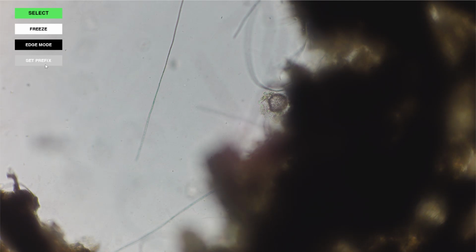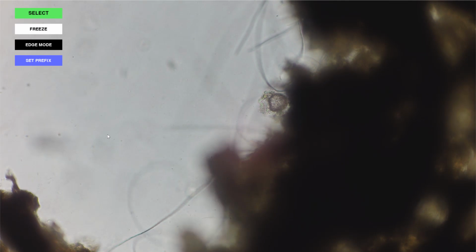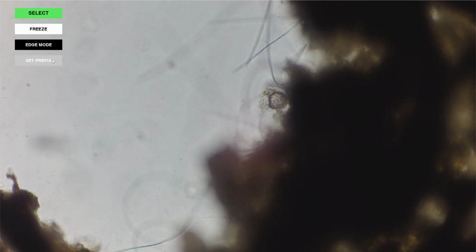element here. Set prefix will allow me to type the name of a particular tag or label for my machine learning dataset. As you may already feel familiar with, the datasets for training machine learning algorithms rely on the proper labeling of the samples. So if you are creating a model that categorizes among different organisms, based on object detection, image recognition and segmentation, then it is important that you use the same labels for the things that are categorically the same. So the way that we address this is by setting a prefix.